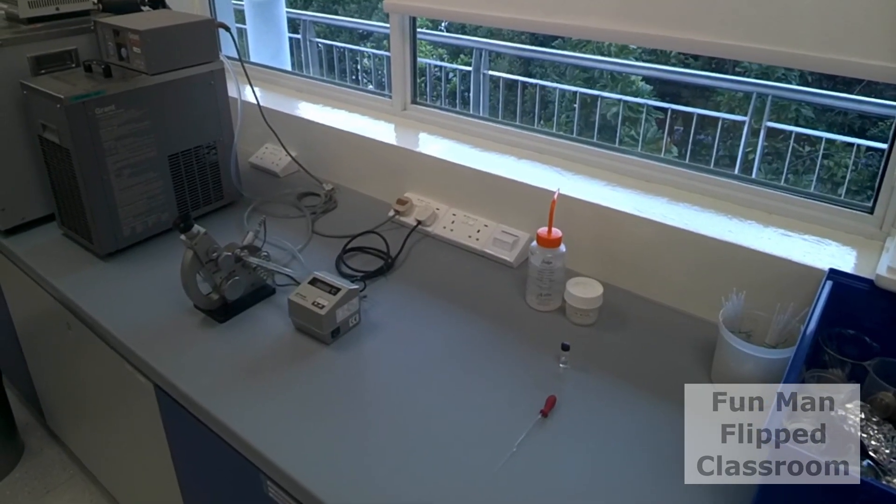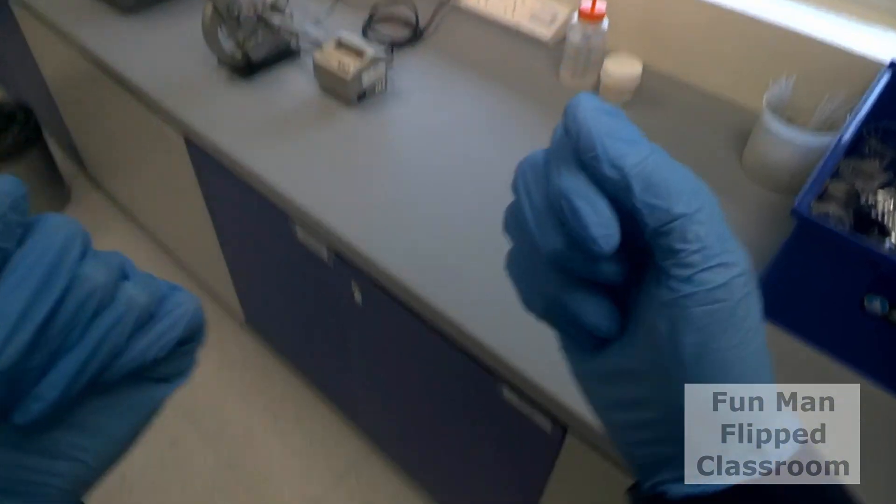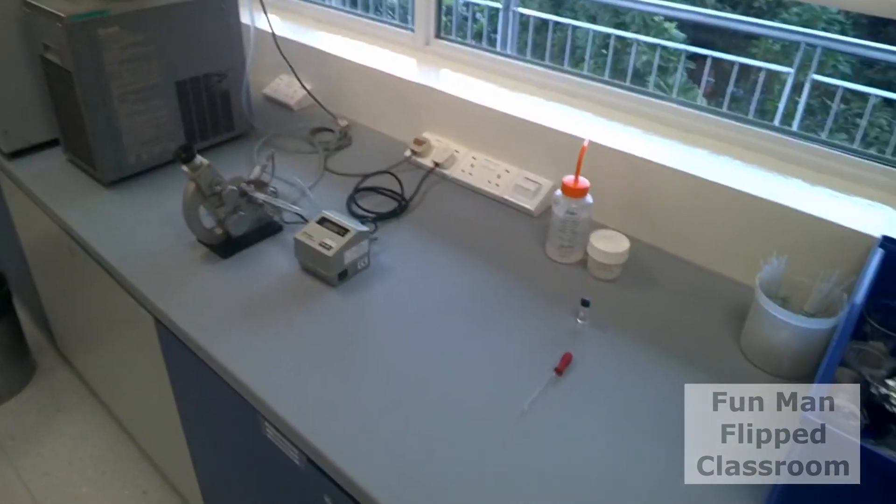Before you start to do anything, please ensure you have your personal protective equipment on you, meaning nitrile gloves, lab coat, cover shoes, and socks that covers and protects your ankles. And of course, the safety goggles which I have already put on.